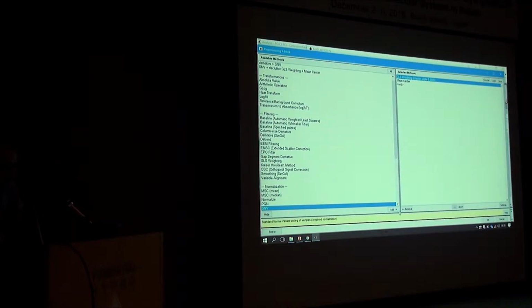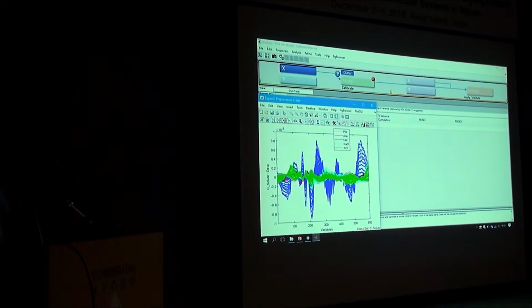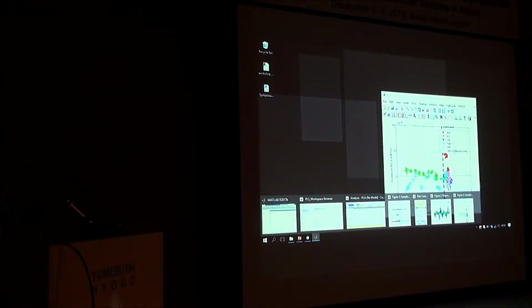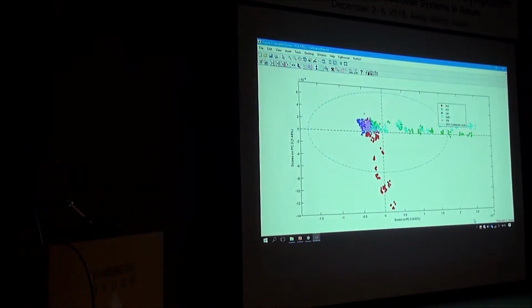So we want to add SNV to this to correct for that multiplicative effect. We add it to the list. So we have got an SNV step followed by GLS weighting, followed by a mean center. Let's do a PCA on that. No, I think it's clearer now. So that SNV was helpful too.